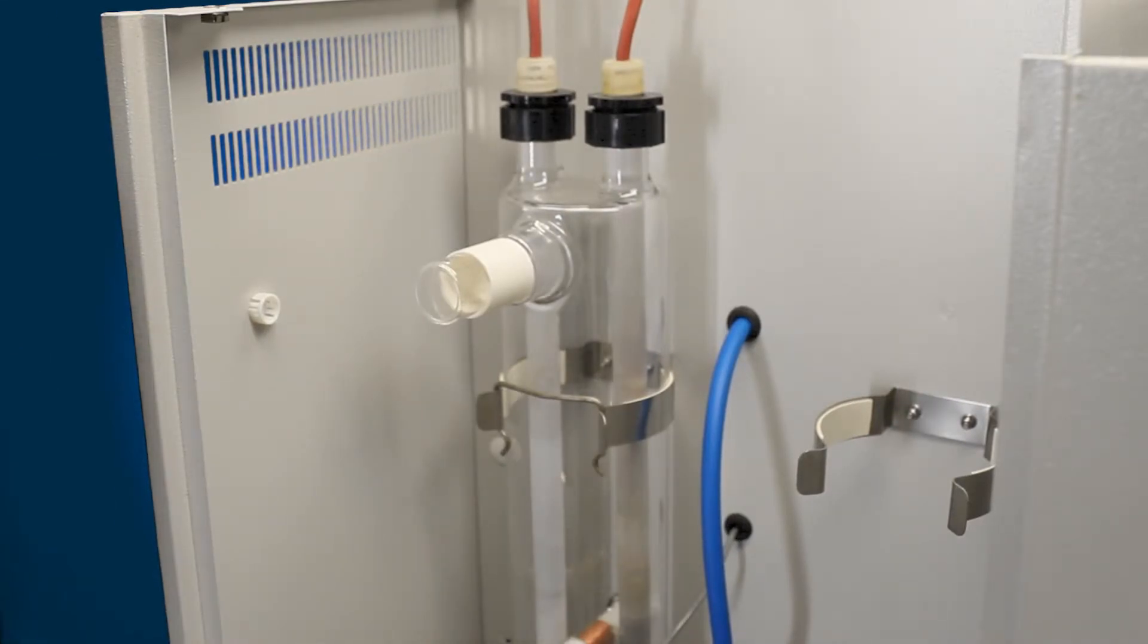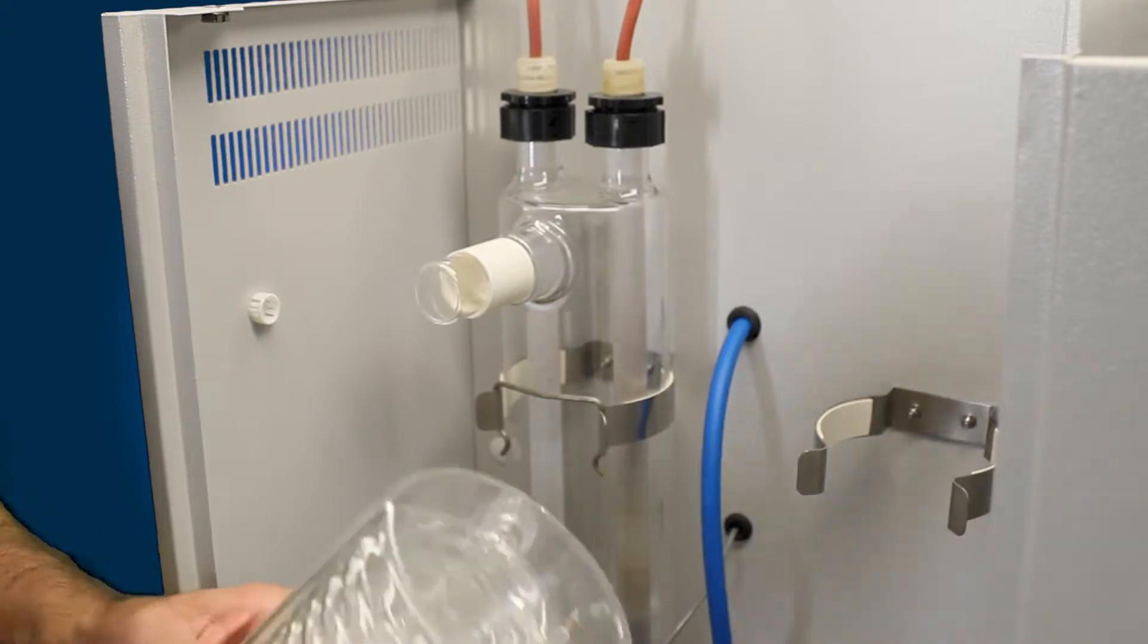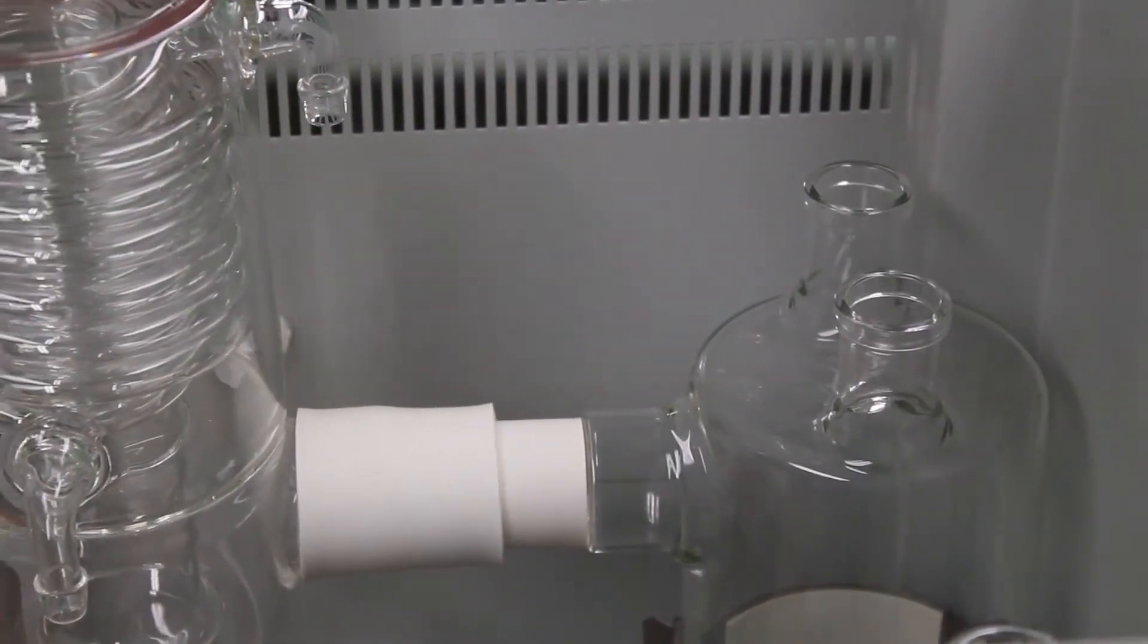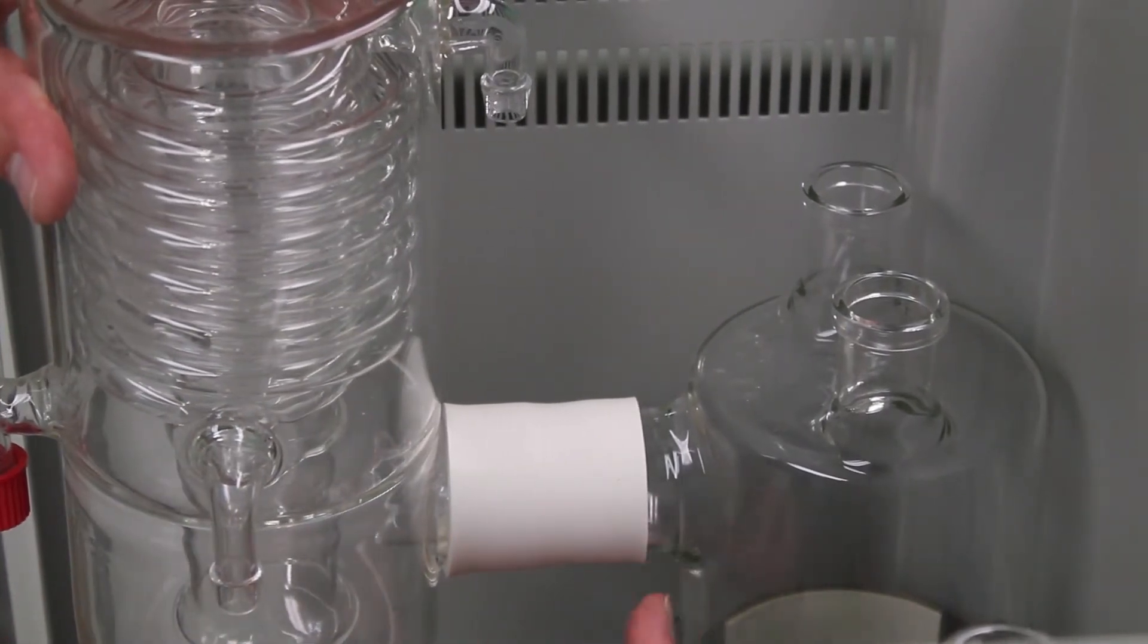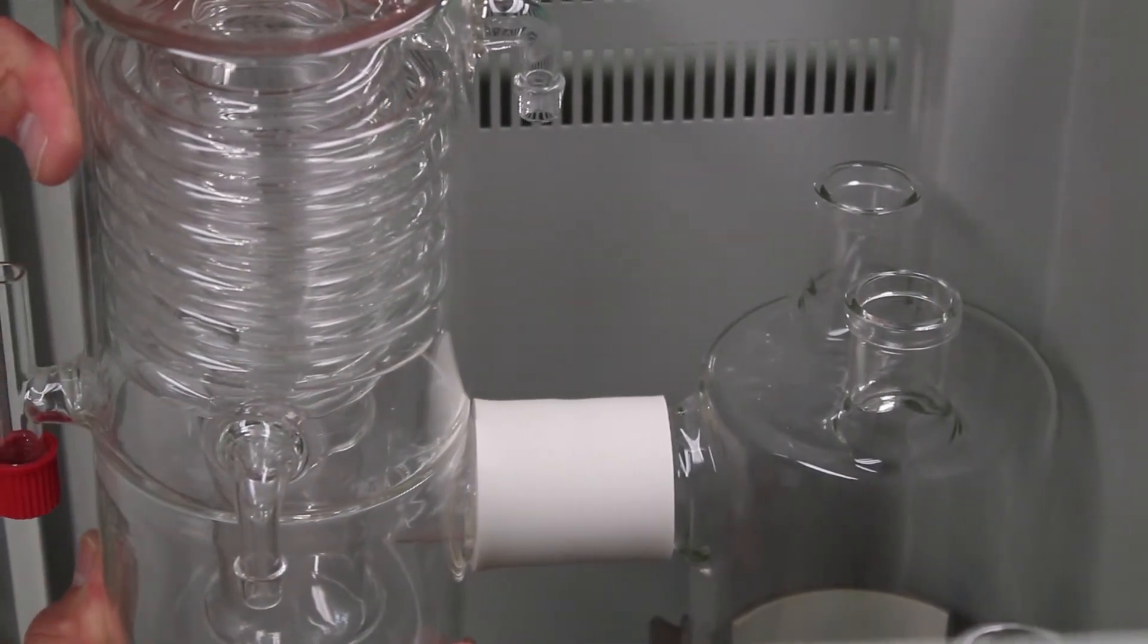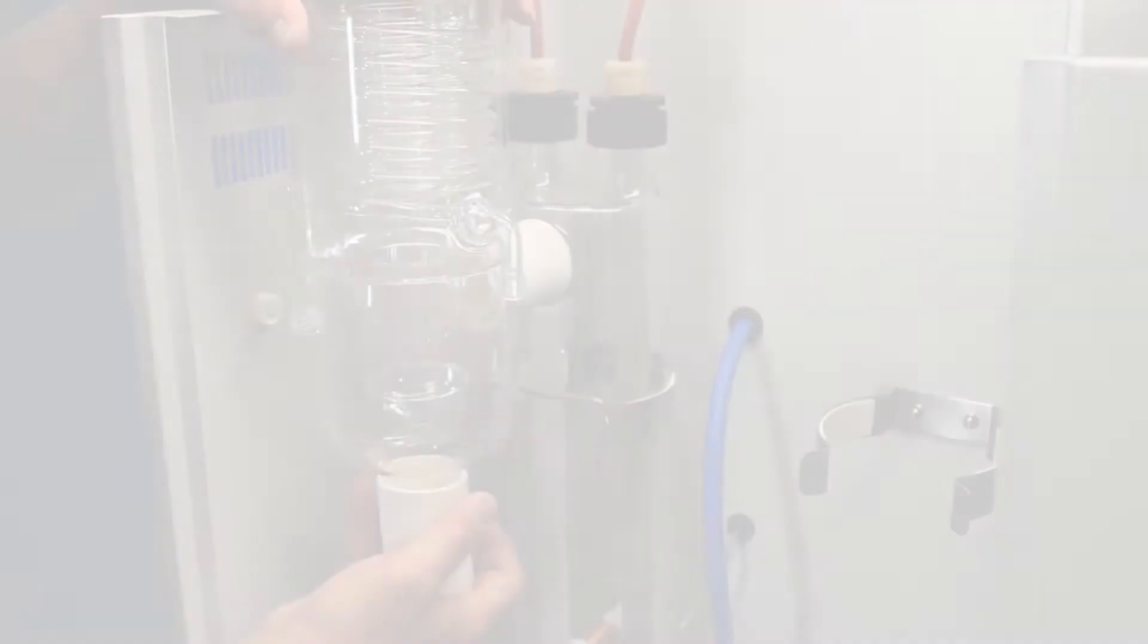Take your new condenser. Put the sleeving on it in place. Slide the condenser back onto the boiler until it goes all the way, until the sleeve goes all the way to the back of the boiler. Put our new sleeve on the bottom of the condenser for our constant level device.